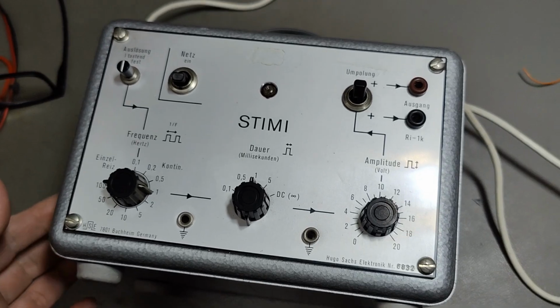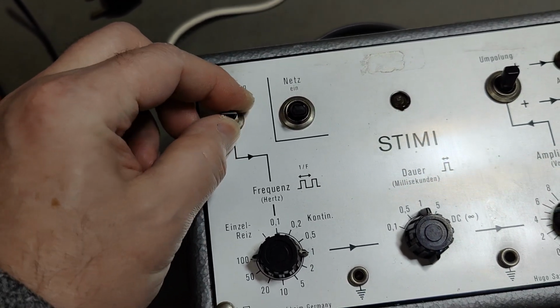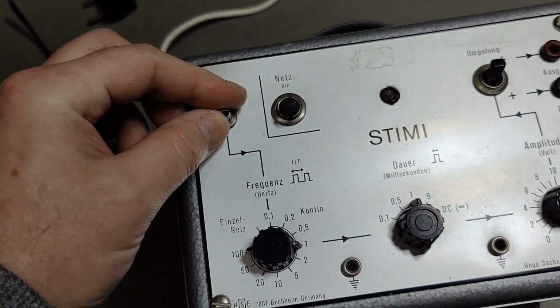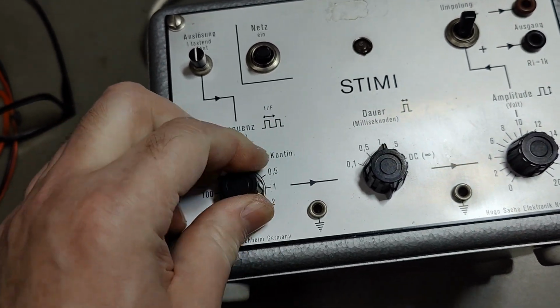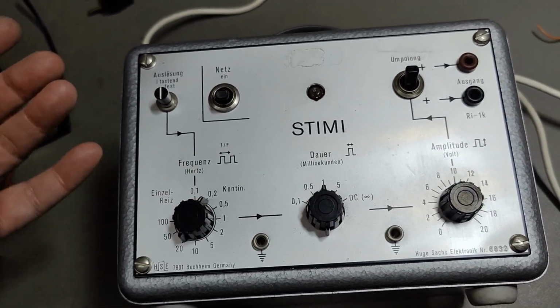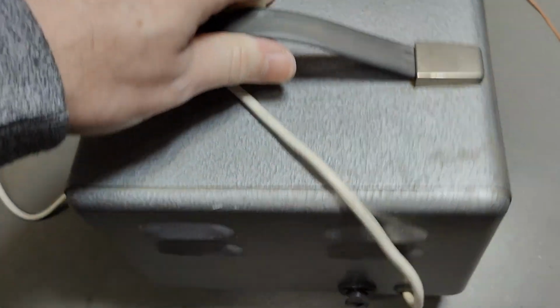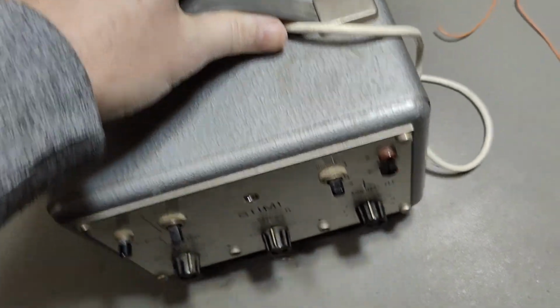There's not a lot else to figure out. What the heck is that funky? You need to push it and then you can rotate that one. And of course that is the frequency. So this is the repeat. And this is the length of the pulse, obviously, right? So this is just a pulse generator of some sort. And then there's only a fuse on the back. Okay, so let's open it and have a look.